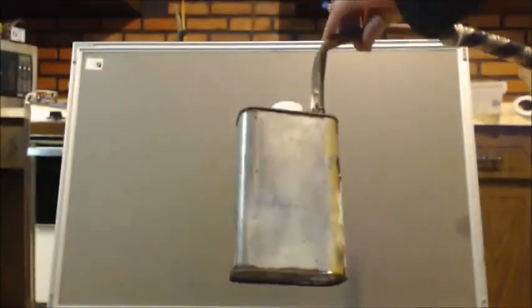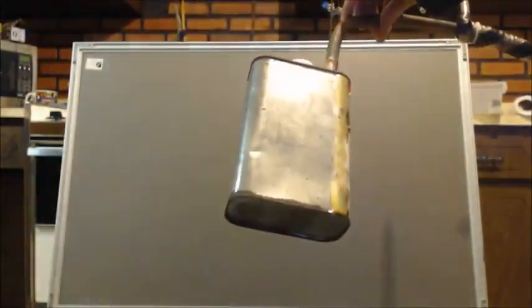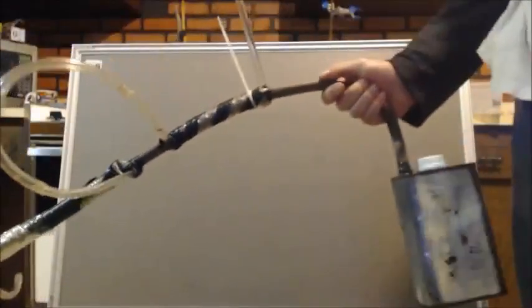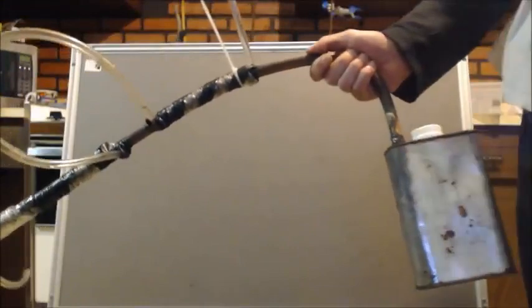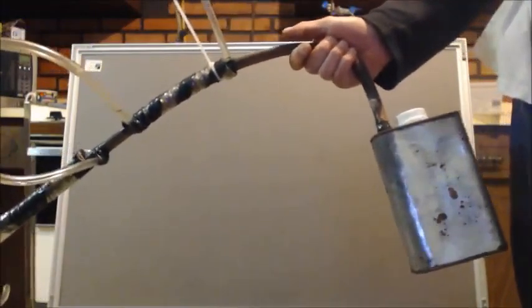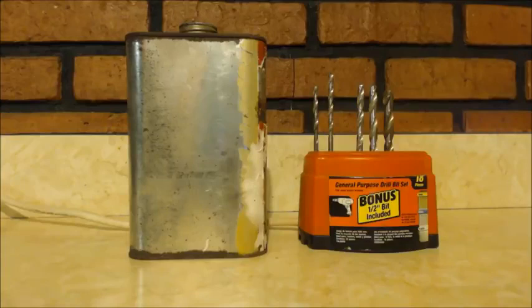I have to distill something, and I don't want it to screw up my glass. I use this kind of thing for calcinations or whatever. Any kind of leak that's going all out on your flame, all out on your heat, all on your lungs, is very unsafe. Here to make a still.